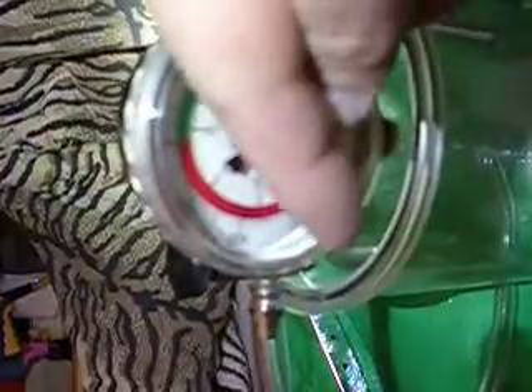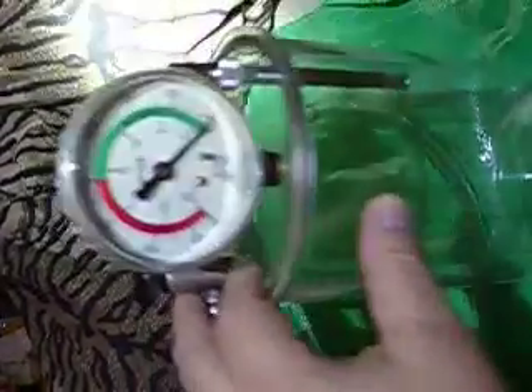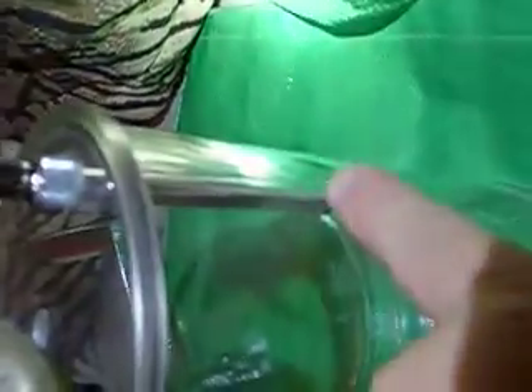Unlike a pressure gauge, it's all in reverse. Normally a pressure gauge goes in this direction, but this one is going to be pulled in the reverse direction — it's basically a backwards Bourdon tube. I've got some pictures of that I can show you. Basically there's a tube in it for the trap.